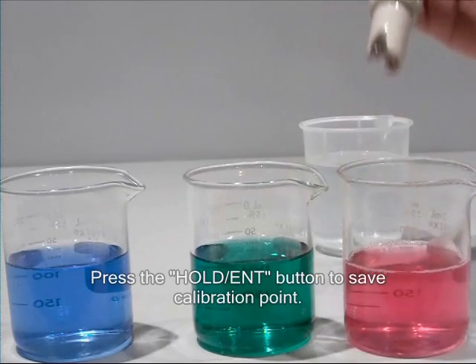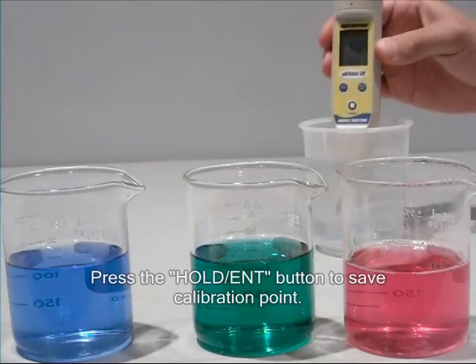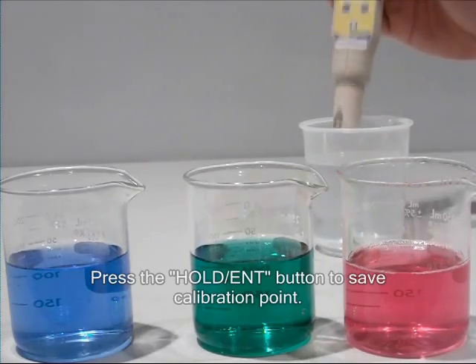Press the HOLD ENTER key, then rinse the electrode, and place in the final pH 10 calibration buffer solution.